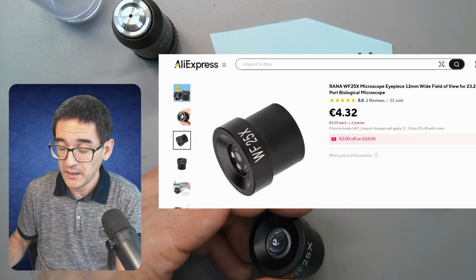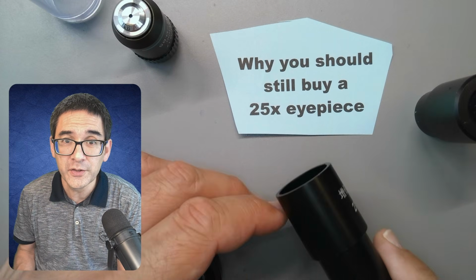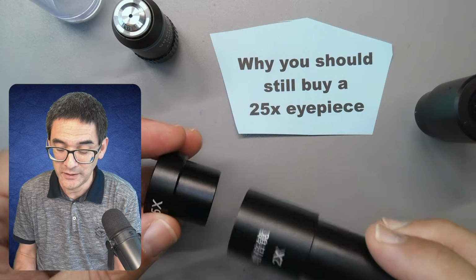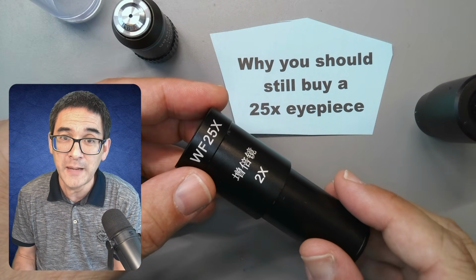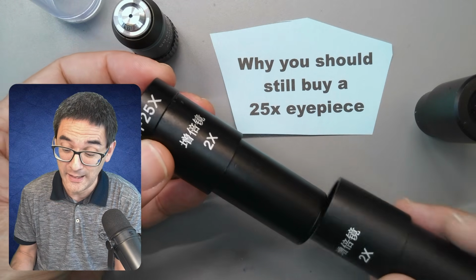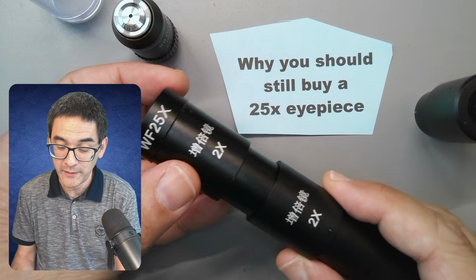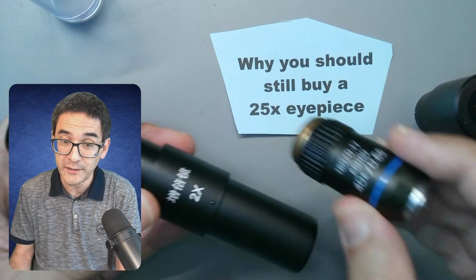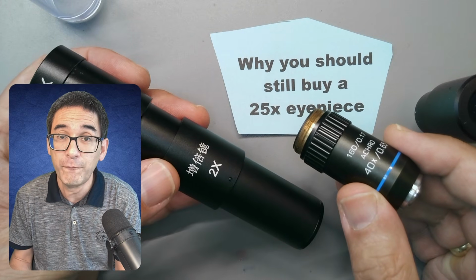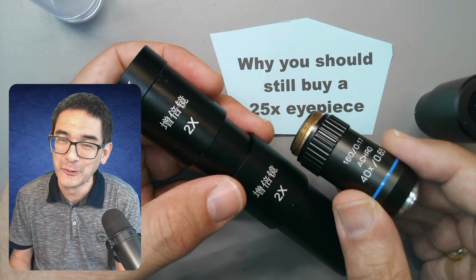And if you say bigger is always better, in this case I recommend that you not only buy yourself a 25 times eyepiece, but also a 2 times Barlow lens. Wow, look at this. Isn't this cool? I've now doubled the magnification to 50 times. And you know what? You can keep on doing that. Look at this. Now I've got 100 times. Bigger is always better, right? And now if I add a 40 times objective to that, 100 times 40, wow, 4,000 times magnification. Isn't this cool? Of course, total nonsense.